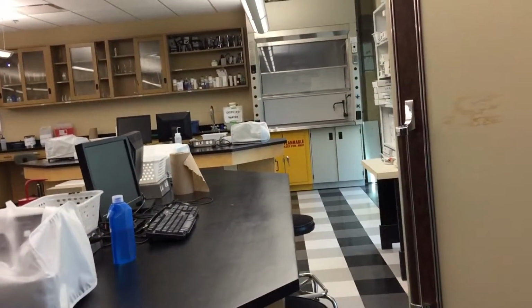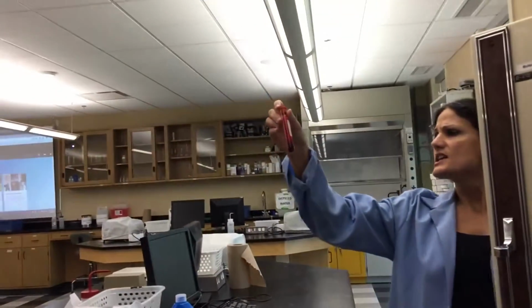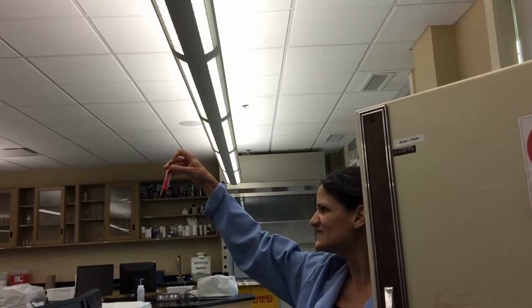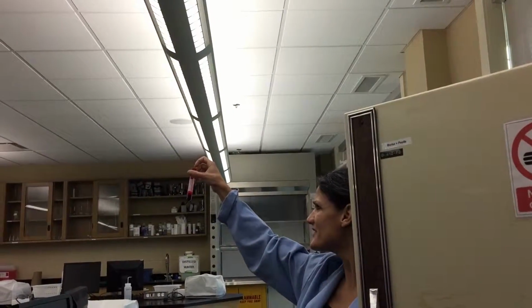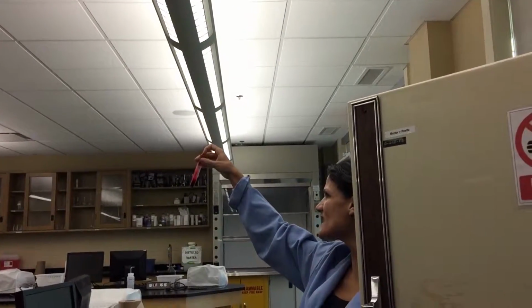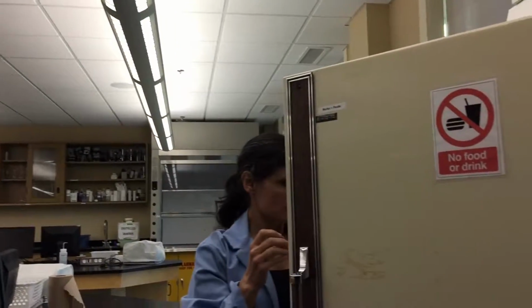This is what happens when you don't put it in, and you say you still can spin that out, or it's done. Somebody poured the serum off it. That's weird, because if it sat like that for that long, the serum would eventually, I find that weird. Anyway, somebody poured it off.